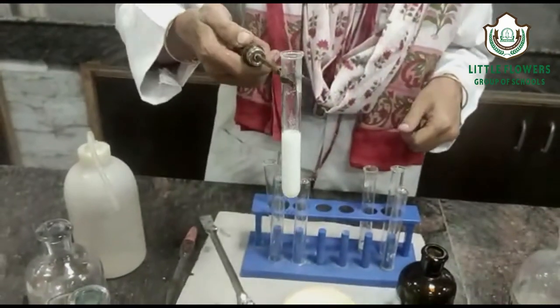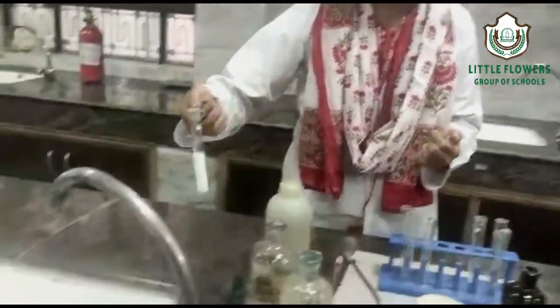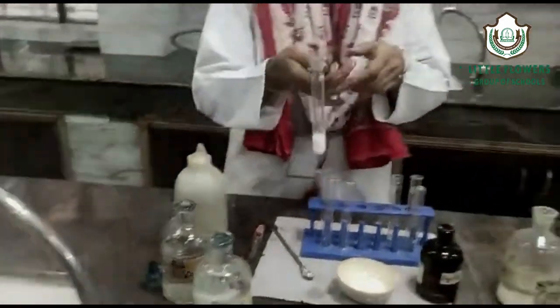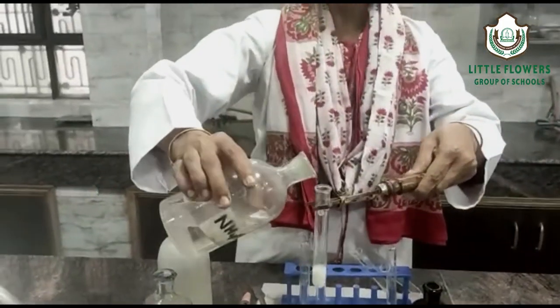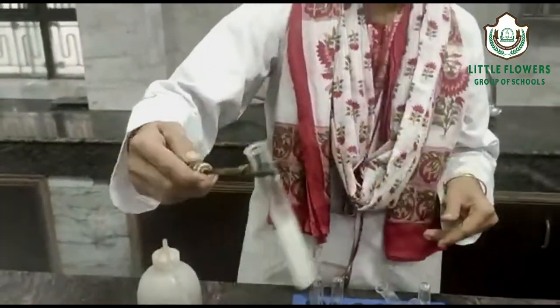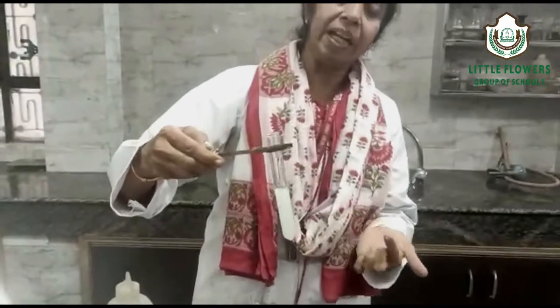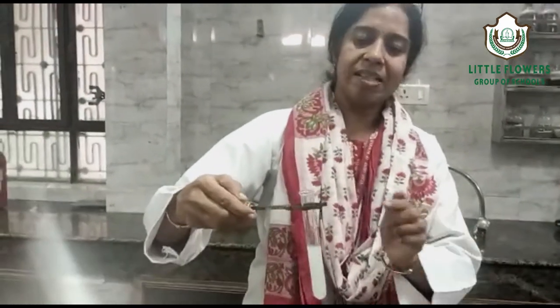Now we will check the solubility of this white precipitate with NH₄OH. To make it easier to check the solubility, we reduce the precipitate. We add NH₄OH to this test tube and wait for a moment. The precipitate is completely dissolved — it is soluble in NH₄OH — which confirms that in the given salt, the Cl⁻ chloride radical is present.